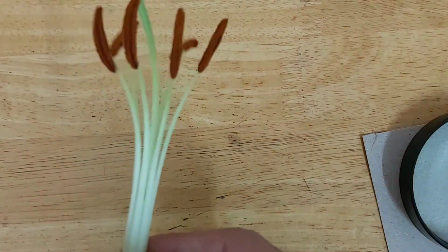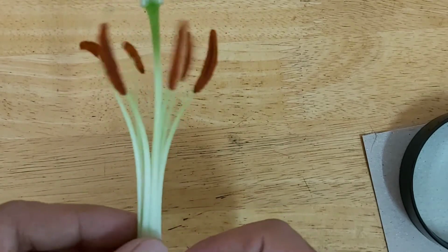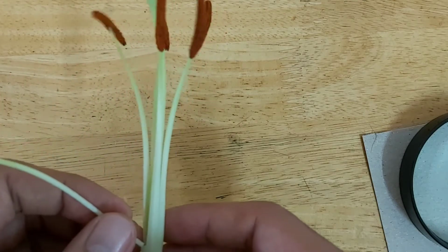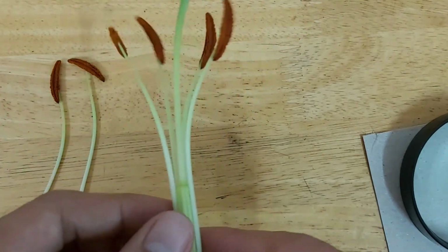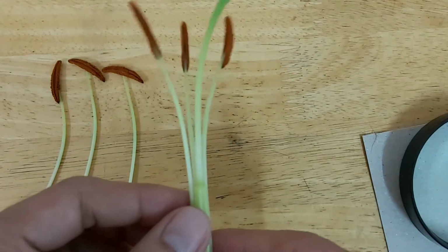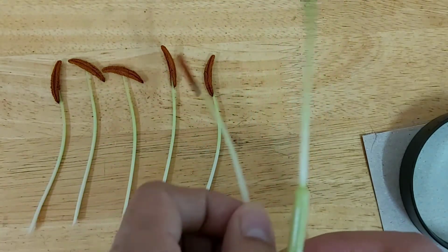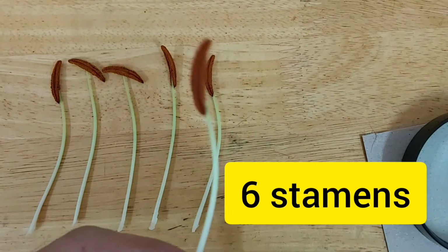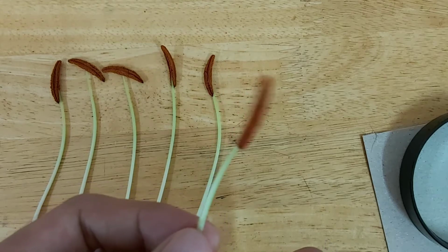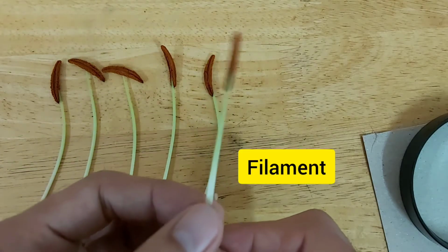Now next, we're going to remove the stamens. The stamens are surrounding the part which is at the middle. So let's remove all the stamens of this flower. We have the first one, 2, 3, 4, 5, and 6. So all in all we have 6 stamens. As you look at one of the stamens, you have the anther, the one which is red orange in color, and the one that supports the anther is the filament.